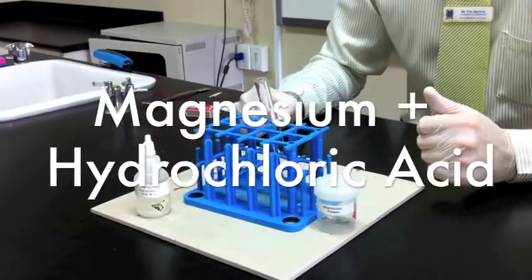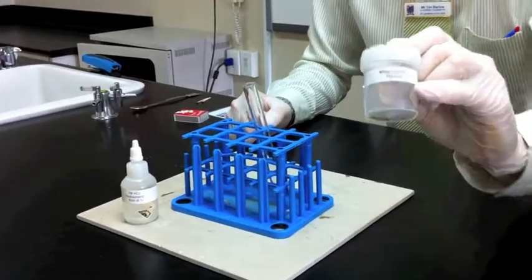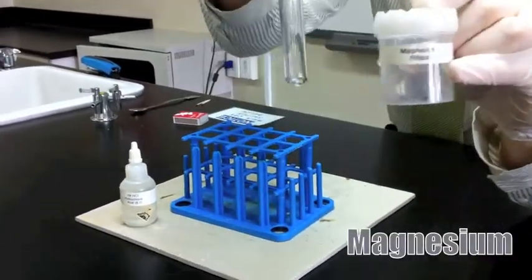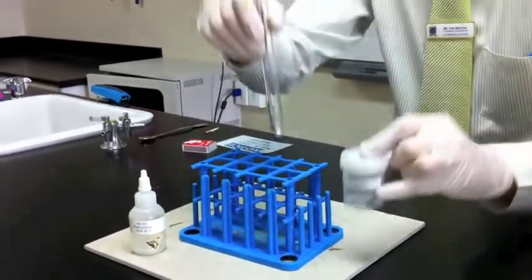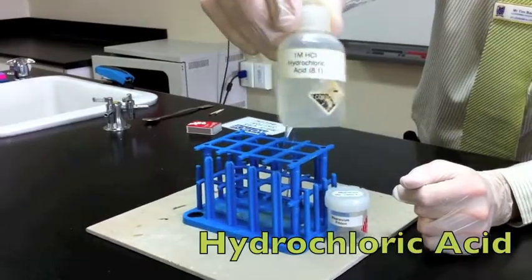Okay, so a great example of a chemical change is what happens when we mix magnesium ribbon. So this is an example of a metal. So this is some magnesium. I've actually already got a little bit of it in my test tube. And what's going to happen when we mix magnesium with some hydrochloric acid?